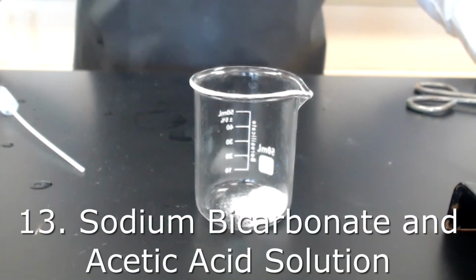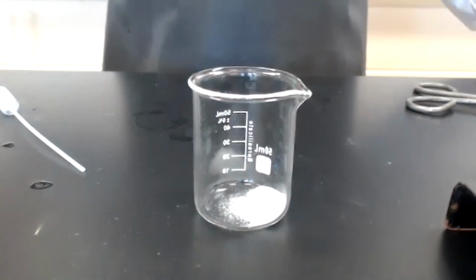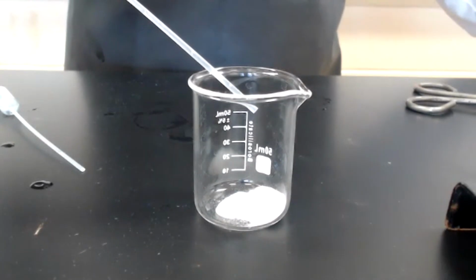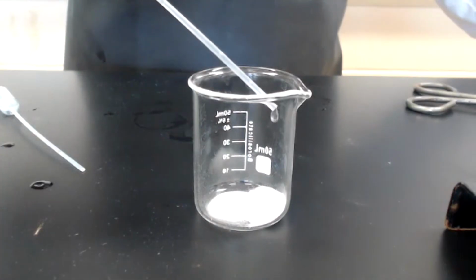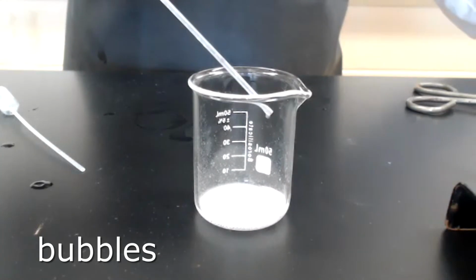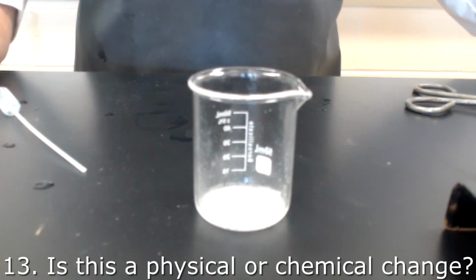In our last experiment, I have weighed out a sample of sodium bicarbonate. I am now going to add the acetic acid solution to the sodium bicarbonate. Is this a physical change or a chemical change?